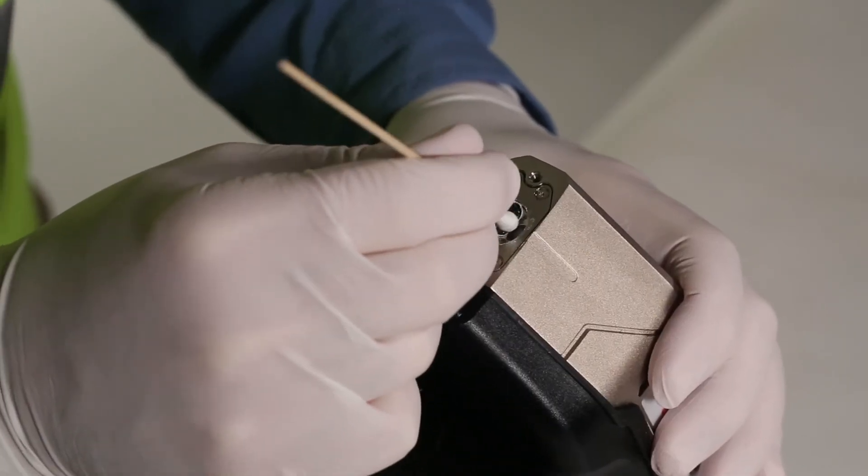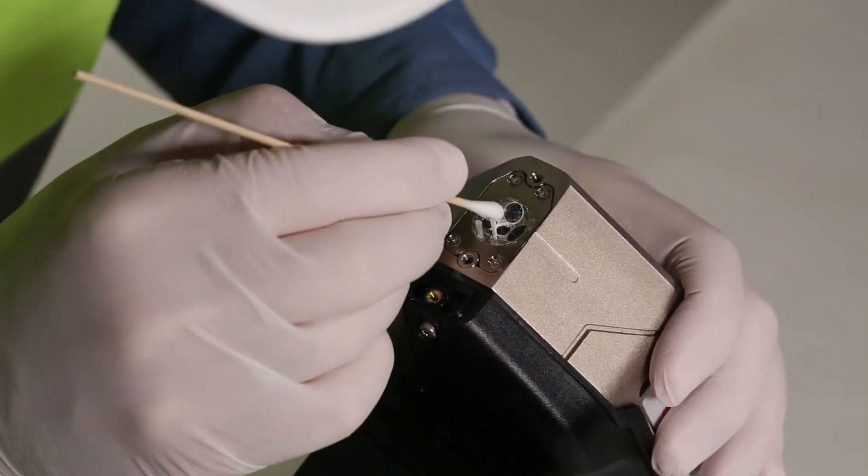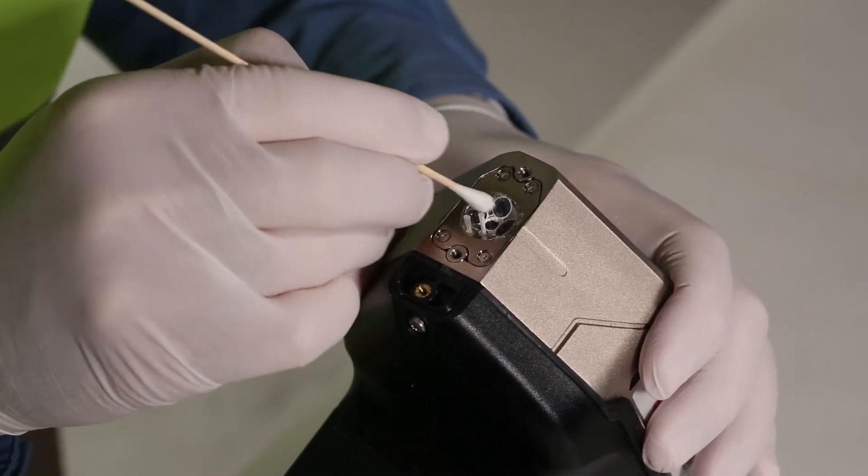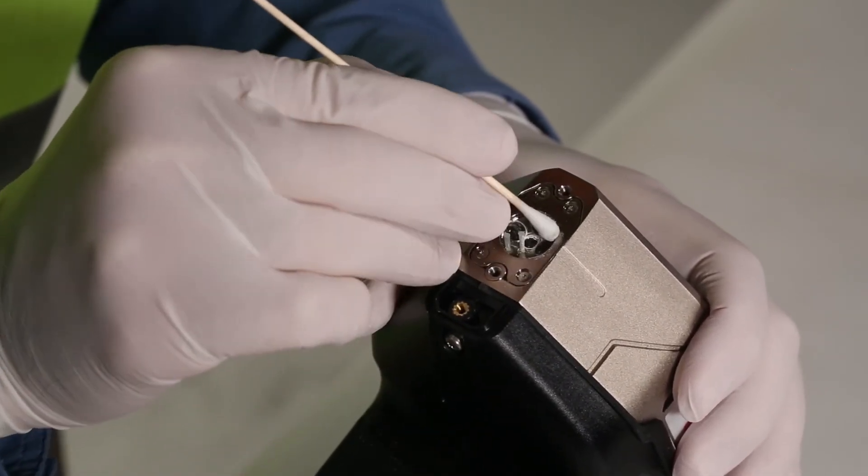Use just enough water to dampen the cotton swab. Ensure no cleaning residue remains around the argon ports and take special care to ensure water does not pool in the sample chamber.